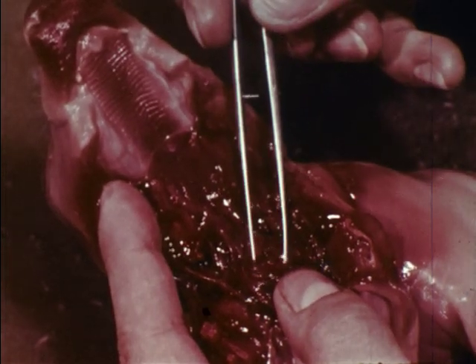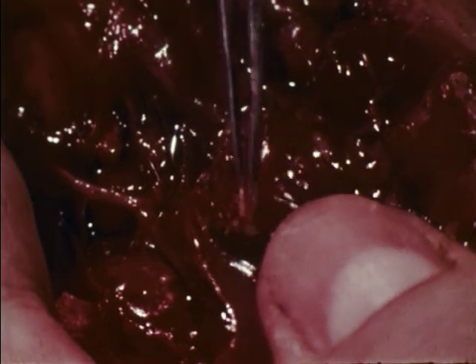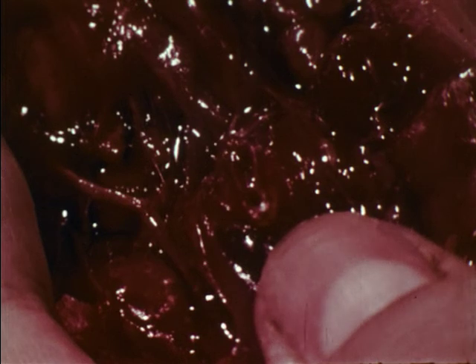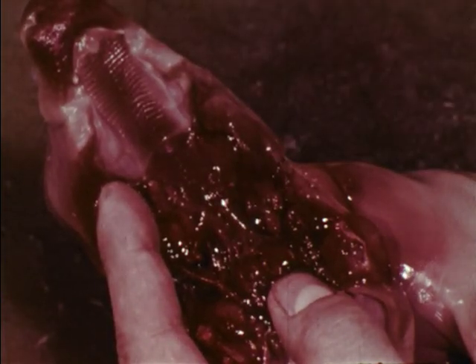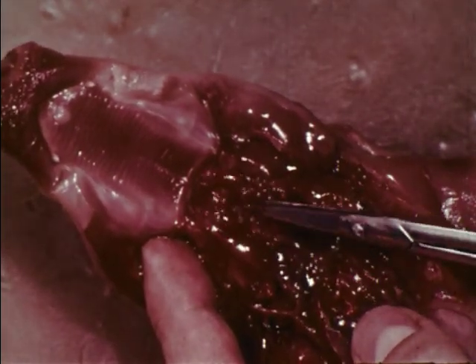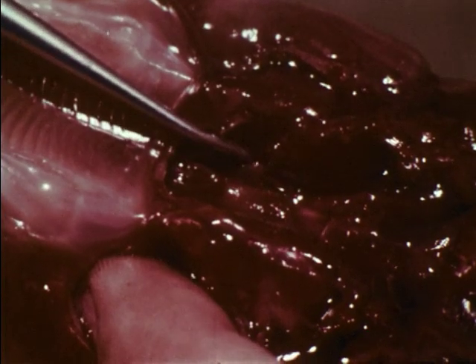Behind the tongue is the respiratory opening or glottis, which is covered by the epiglottis when swallowing. Behind the glottis is the opening to the esophagus. Removing the soft palate shows the two openings of the eustachian tubes. Each tube connects the throat to a middle ear.